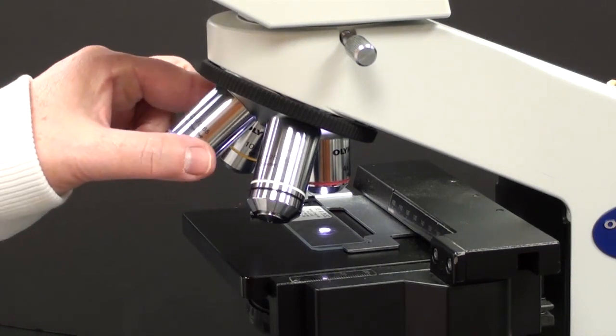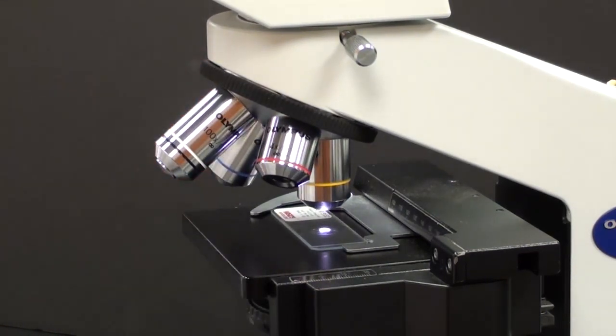Now you can change lenses. We're switching to the next highest objective lens, which in this case is the 10x lens. Use of this lens means we're magnifying the object a hundred times, 100x.